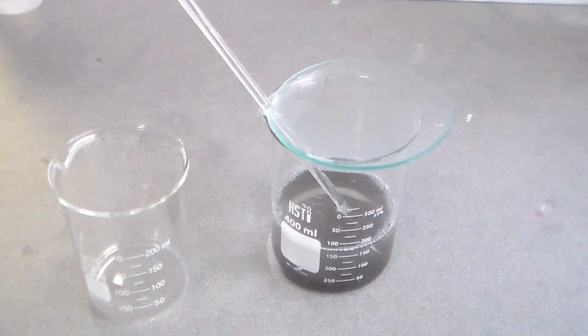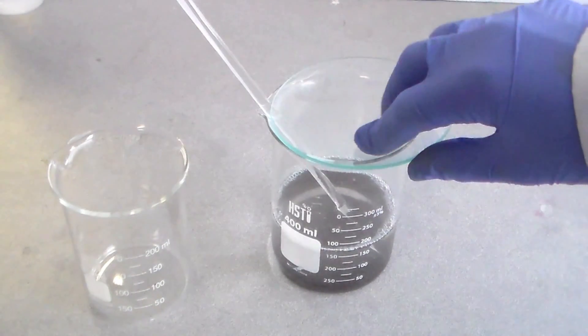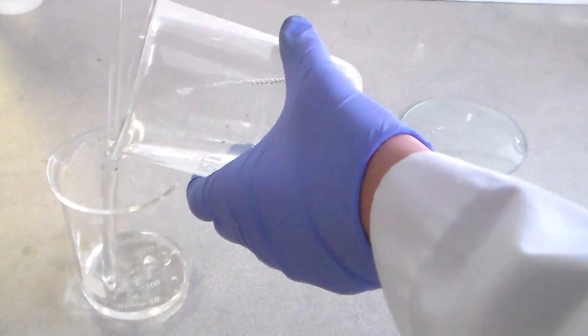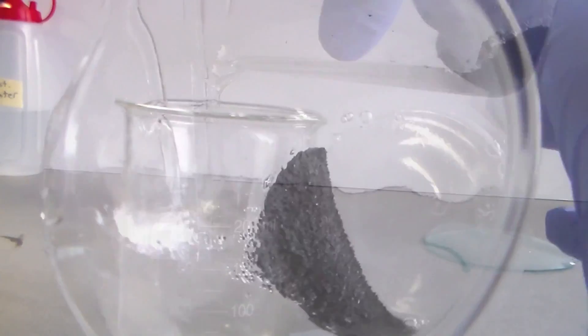I let the products bathe in hydrochloric acid overnight. The next morning, I decanted the solution and vacuum filtered the solid products.